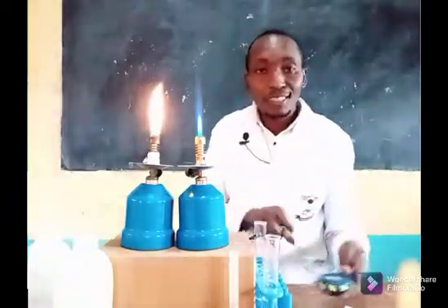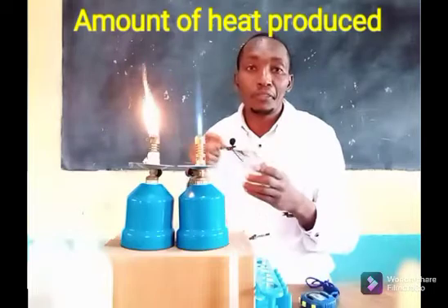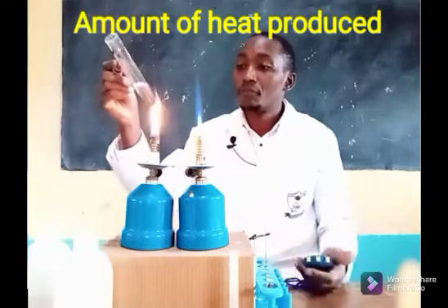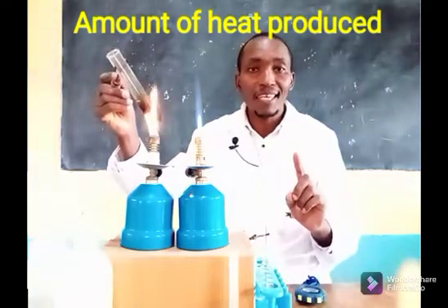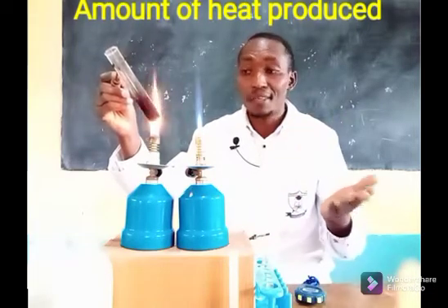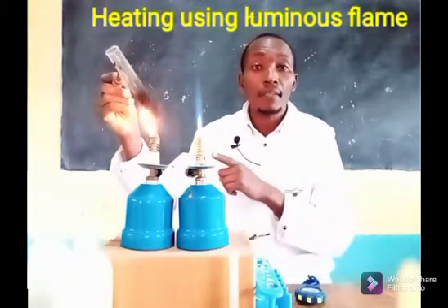I will reset the stopwatch and now use the luminous flame to heat an equal amount of water — 20 cubic centimetres. I start the stopwatch. Notice what is happening to my boiling tube as I am heating with the luminous flame.